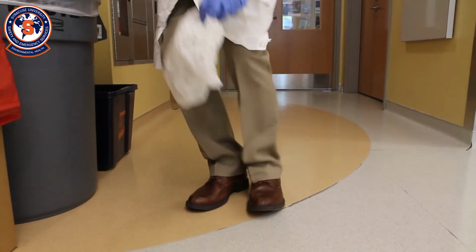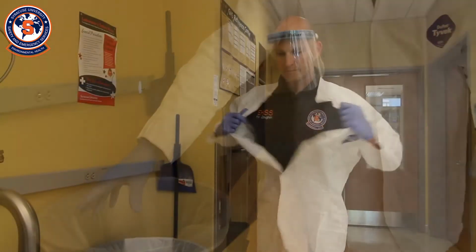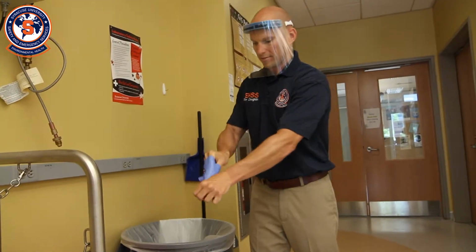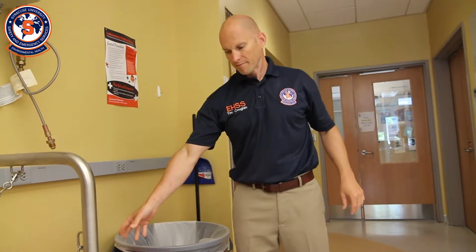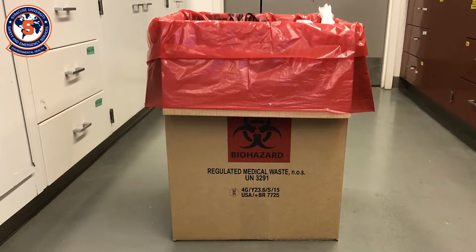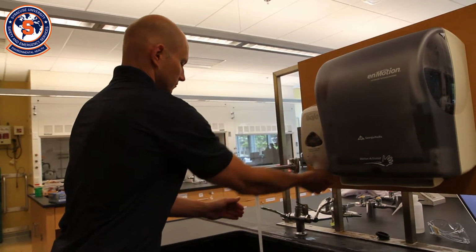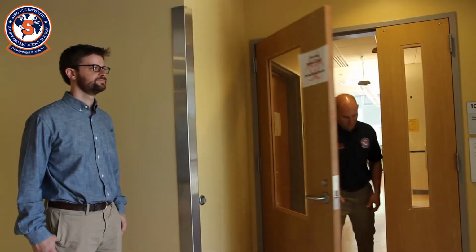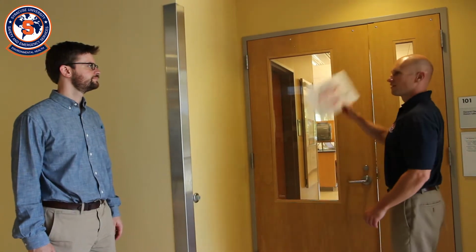First, remove your shoe covers, followed by your outer gloves. Next, remove your lab coat, inner gloves, and finally, your eye protection. Remember to properly dispose of any non-reusable PPE in an appropriate biohazardous waste container. Always wash your hands thoroughly after all PPE is removed. Once the spill has been safely cleaned, you may inform others that it's safe for them to re-enter the lab.